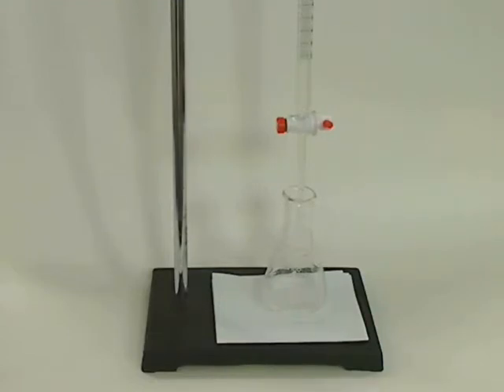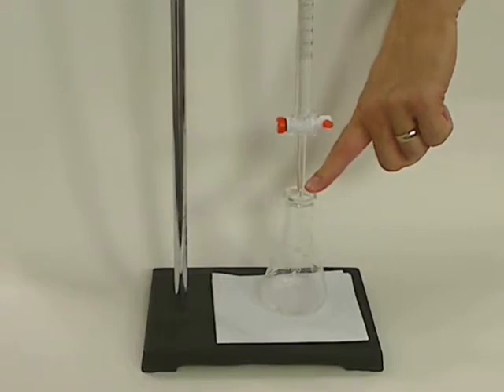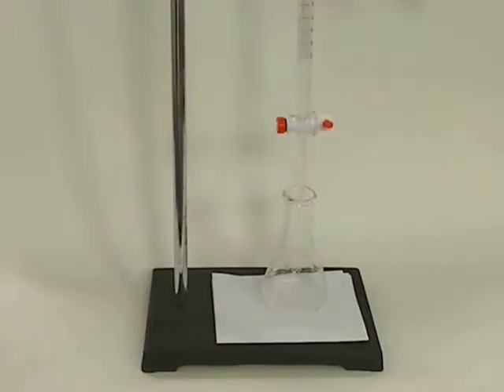Also, monitor and watch your burette to make sure that no drops appear at the bottom of the tip. Sometimes if the stopcock is not properly adjusted, it will drip slightly, which is not good because you'll have titrant continually coming out of the tip.